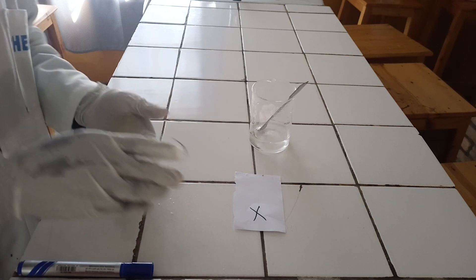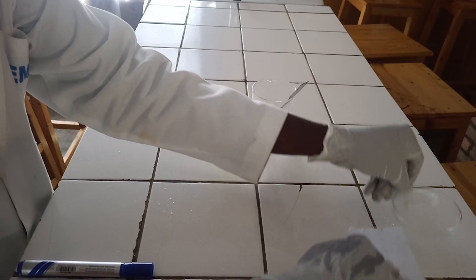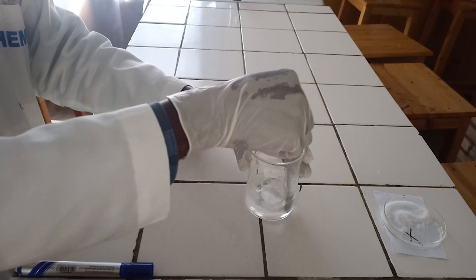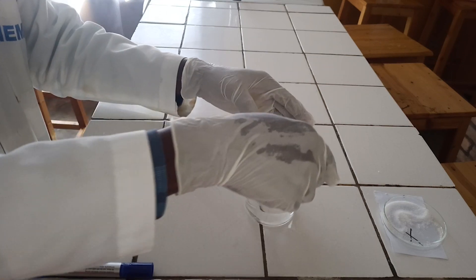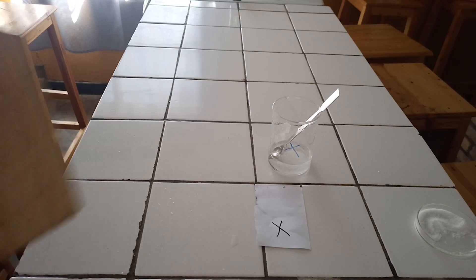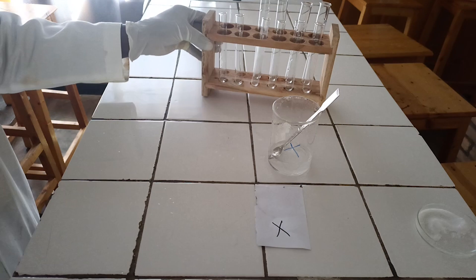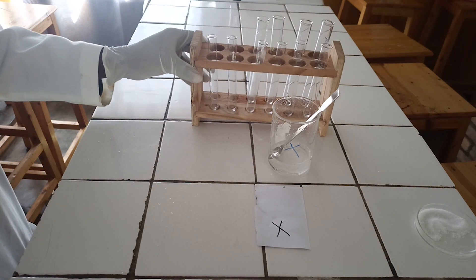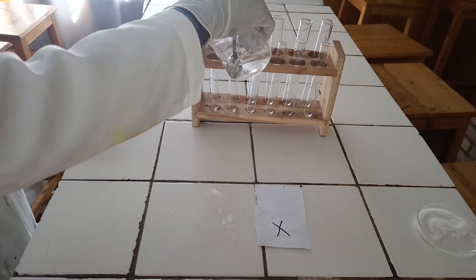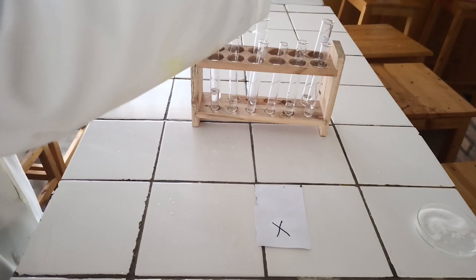When salts of barium ions dissolve in water, they form a colorless solution. Divide the solution into test tubes, putting around 5 milliliters in each test tube.